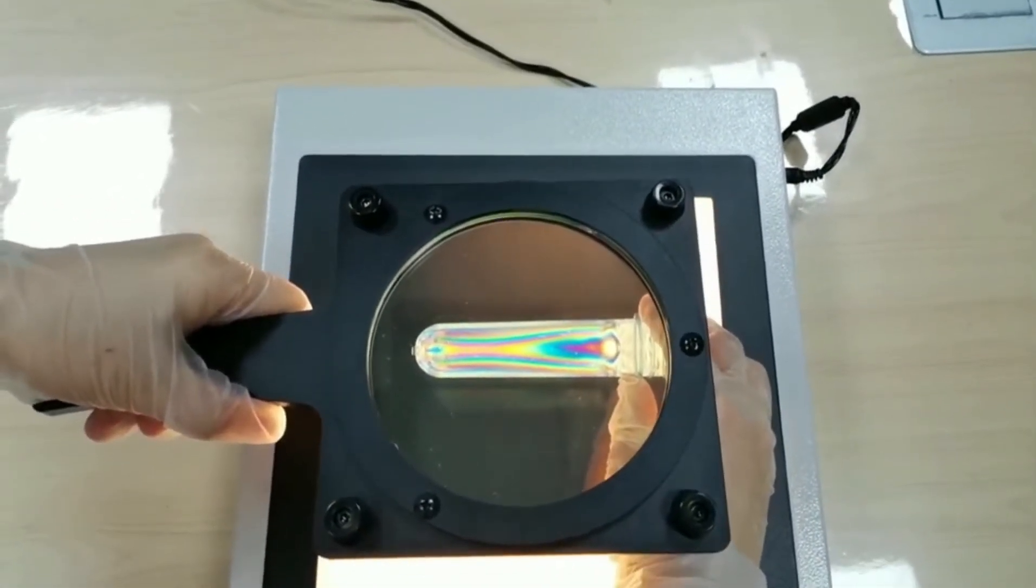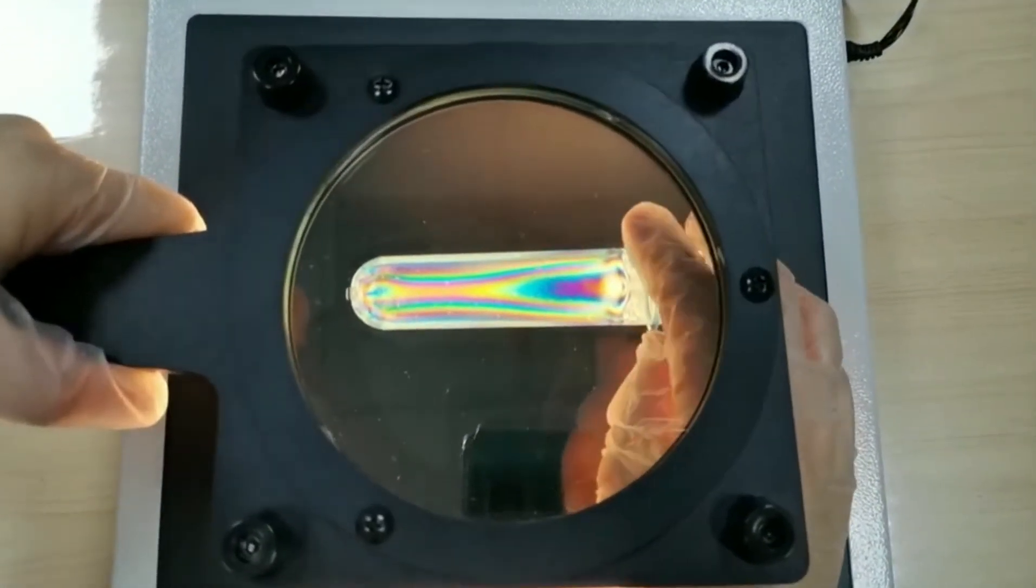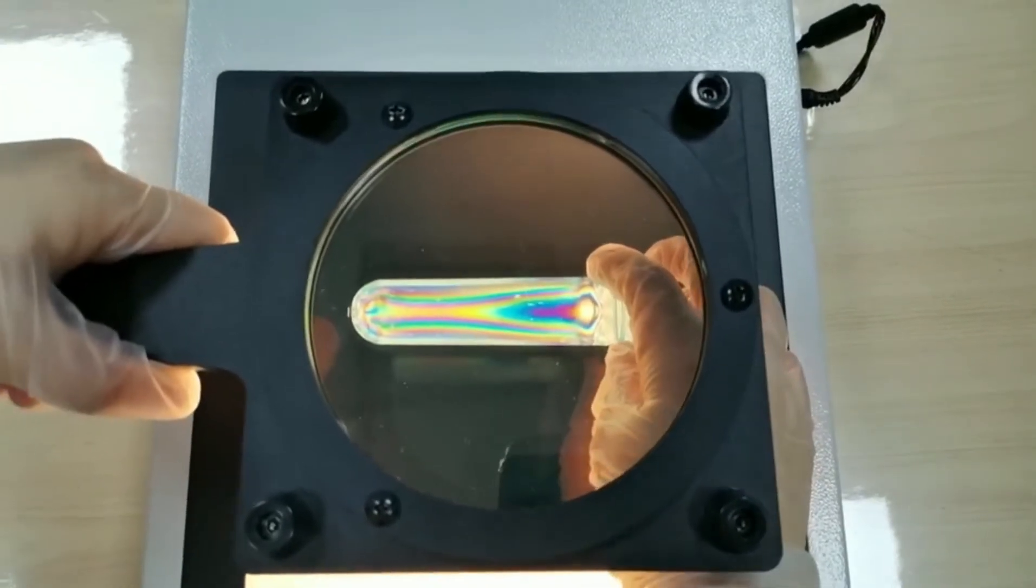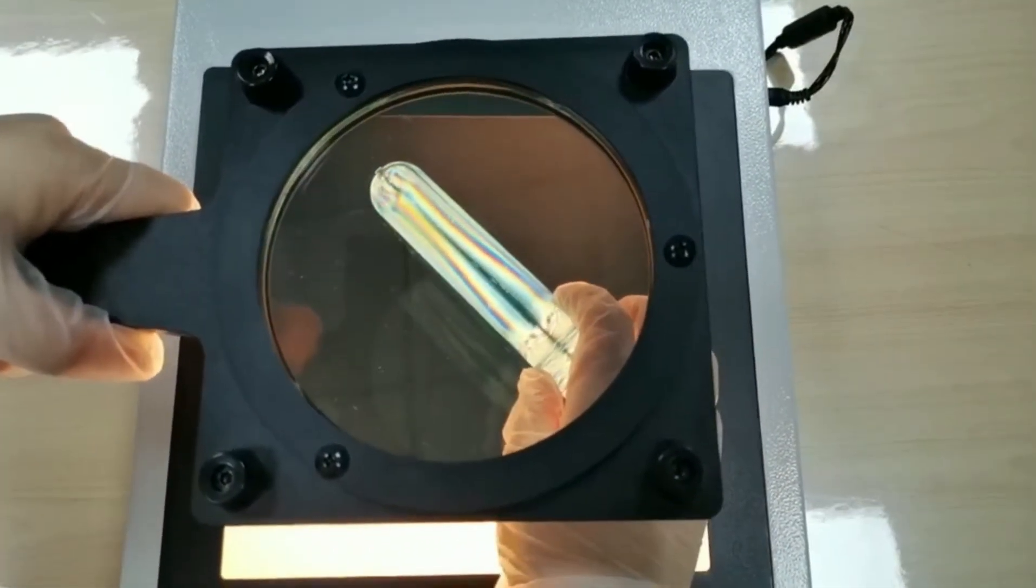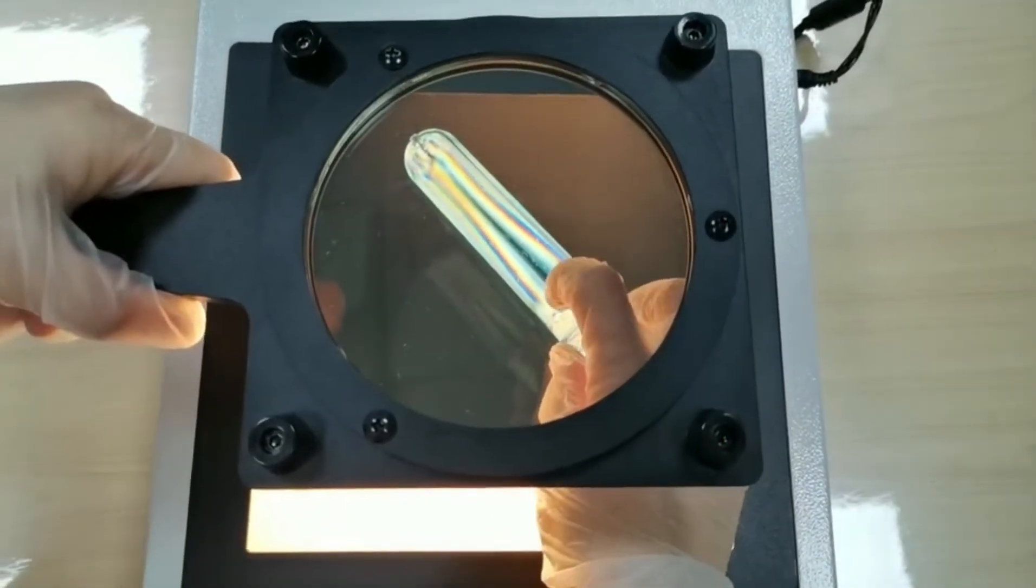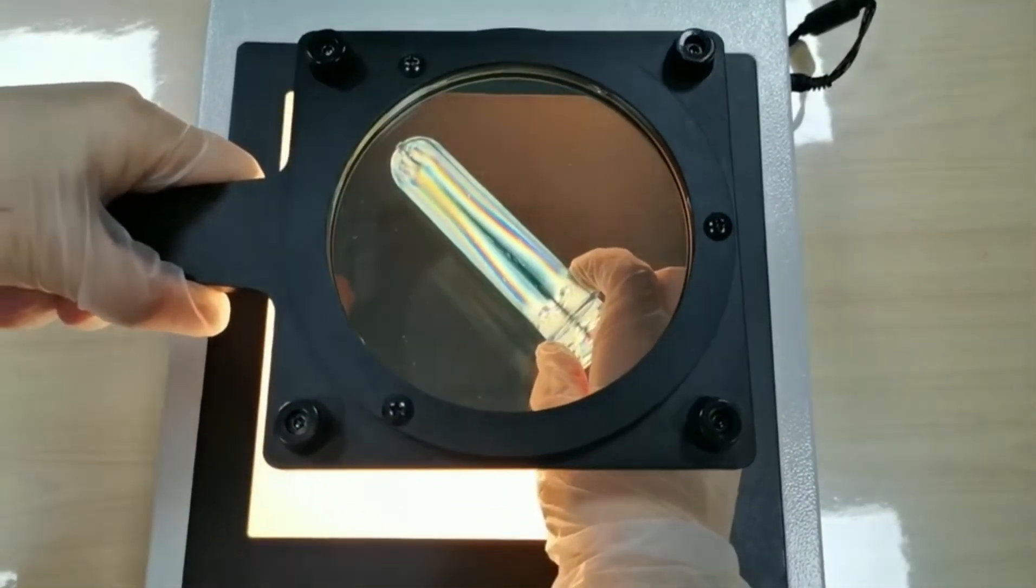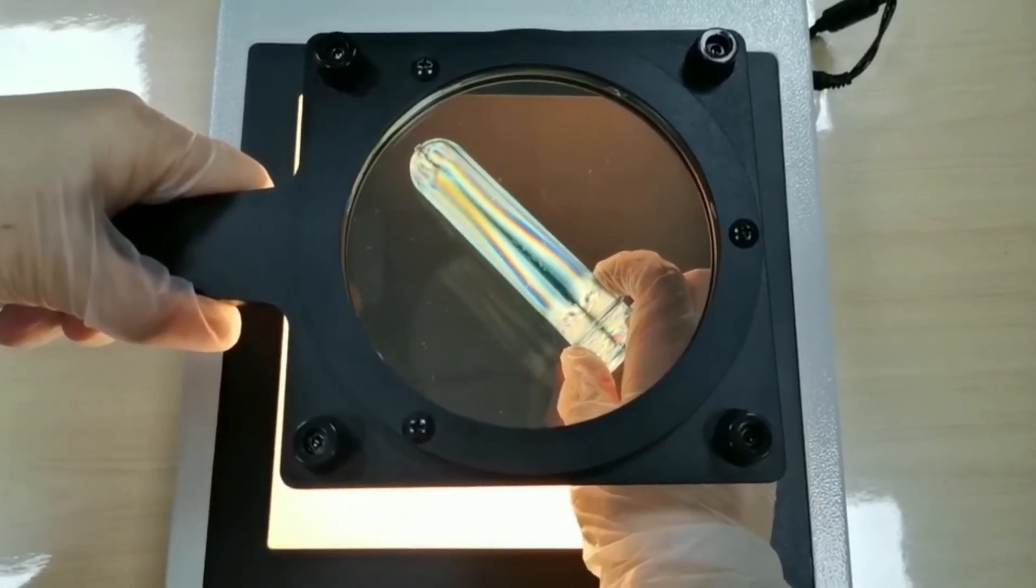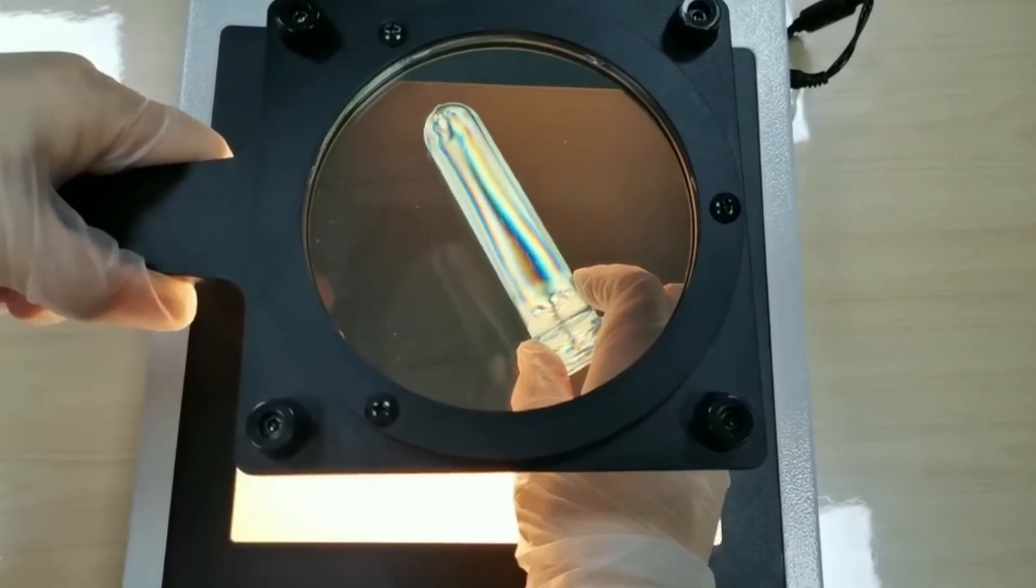In this direction, we can see colored strips in the side walls of the preform. Let's continue to rotate it. When the preform is placed in this angle, we can see clear black fringe in the center. Some manufacturers call this the black stress line. Let's continue to rotate.